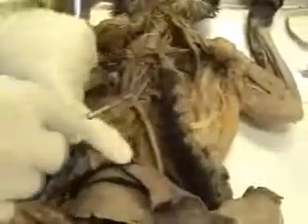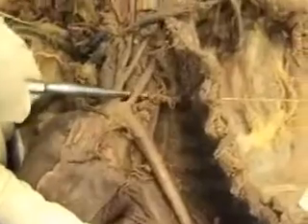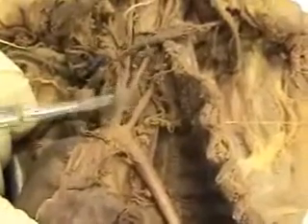Now we're going to look at the arteries, some of the blood vessels. This is the heart. Coming off the heart, this is the aorta. And here we can see the aortic arch. On the cat, there's two arteries branching off the aortic arch. The first one is the brachiocephalic artery. The second is the left subclavian artery. We'll come back to those later.